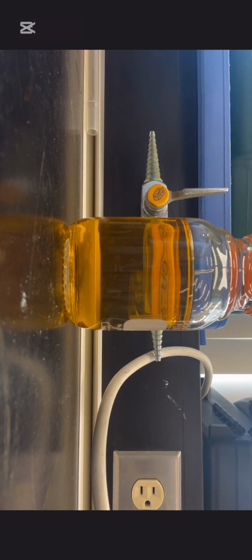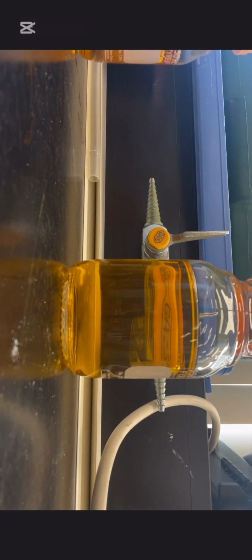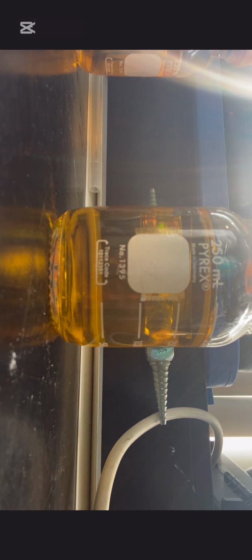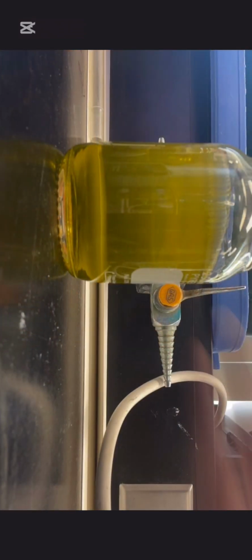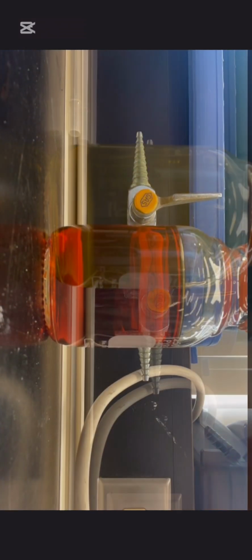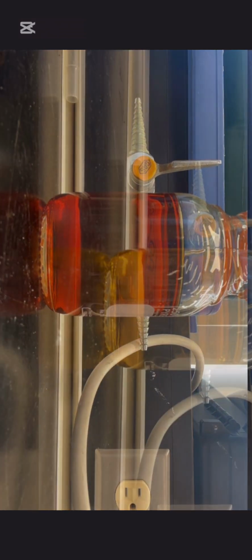But then we set up a time lapse, and this is what we got. We couldn't really see the green at the start because it's right when you shake it, and then it turns immediately red. So then I got some pictures to show a better demonstration, and I also slowed down the time lapse to show each stage of this reaction. So there's the green, and then the red, and then the yellow.